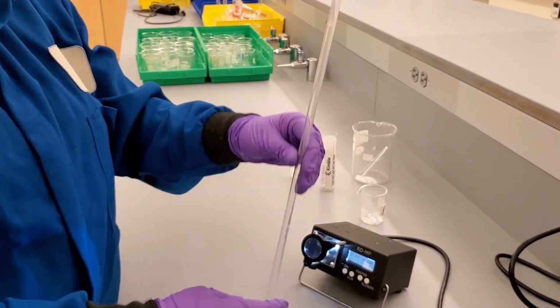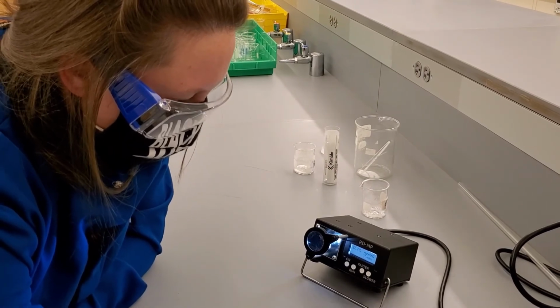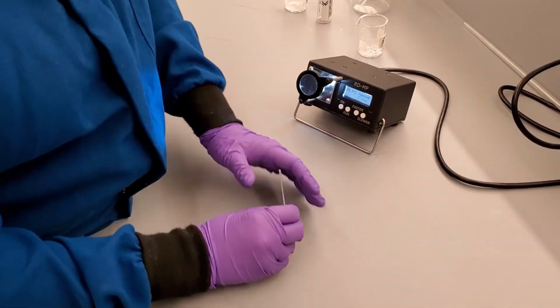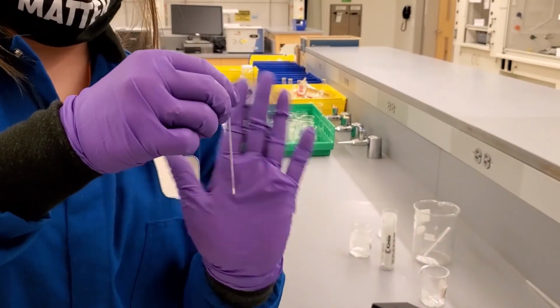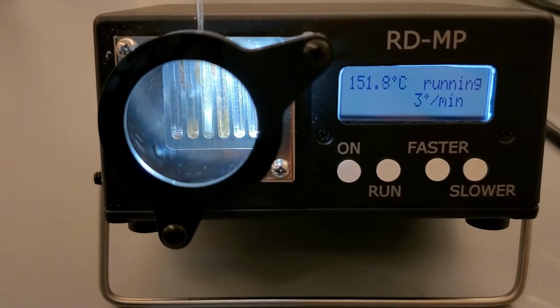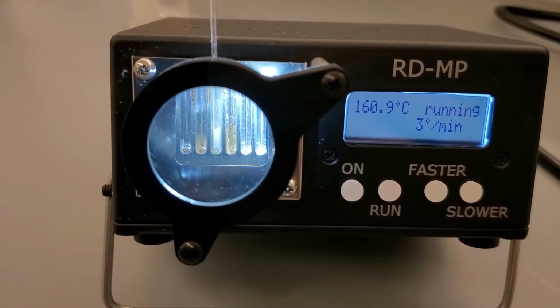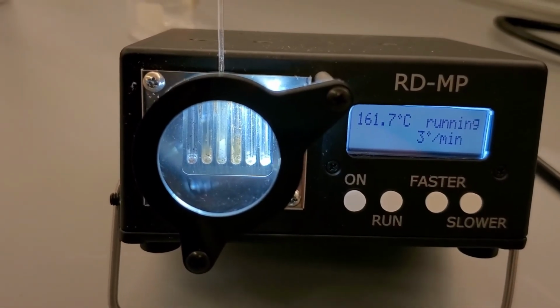We tap the salicylic acid capillary tube on the bench and the product starts to fall. We try the glass tube, but it is now too staticky. We keep tapping until the product is at the bottom of the capillary, put it in the slot of the melt temp, and ramp up the temperature faster. When we are 10 degrees from the melting point, we put the ramping on the slowest setting. Again, the morphology starts to change as we approach the melting point. The pure salicylic acid starts melting at 161.1 degrees Celsius and finishes at 164.6 degrees Celsius.